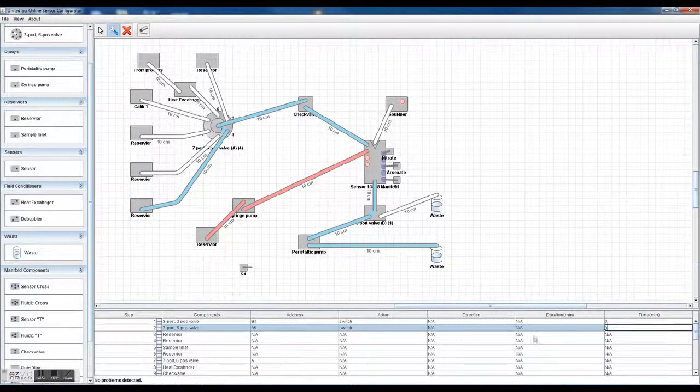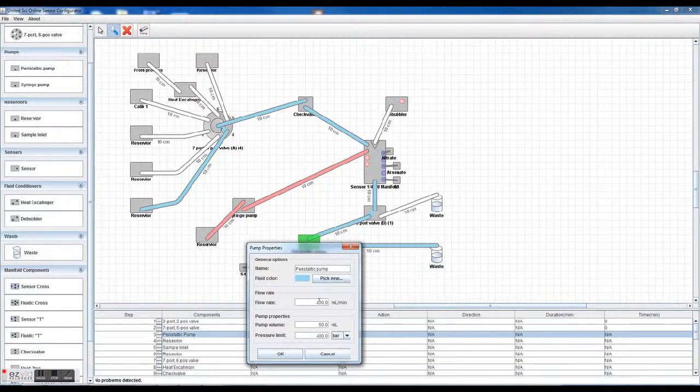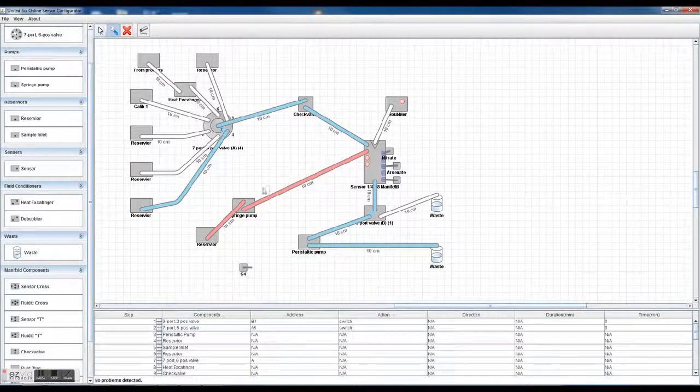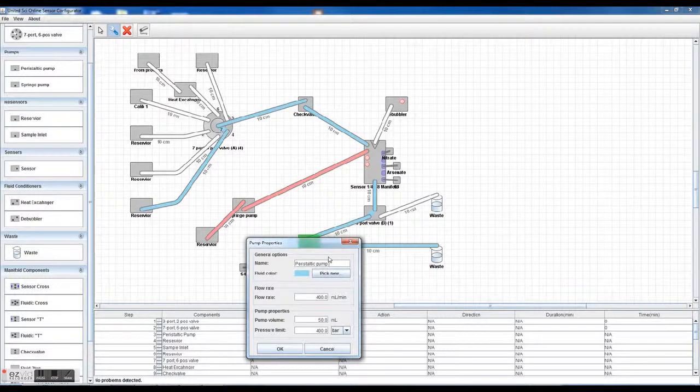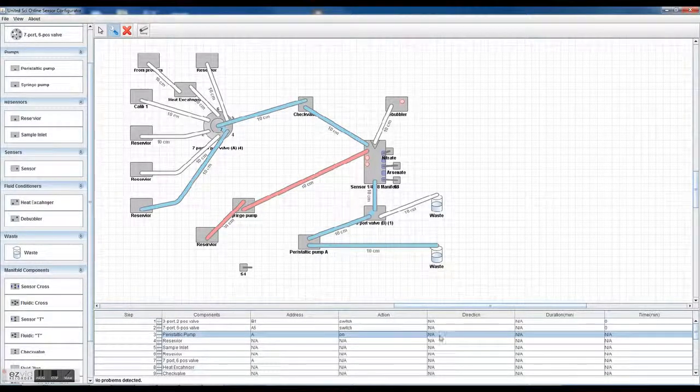And then maybe I want to turn my peristaltic pump on. There are different options, but I can address this peristaltic pump fairly easily. I'll just call it peristaltic pump A, and I want to turn it on, and I want it to go forward for a duration of 3 minutes. Now, I specified a flow rate here. You want to make sure that the flow rate times the time is going to equal the flush volume.